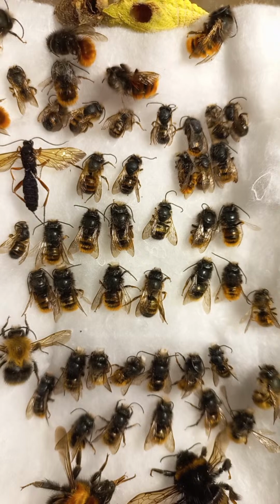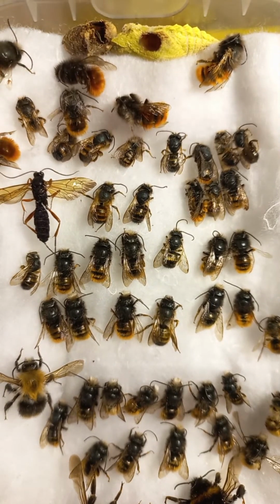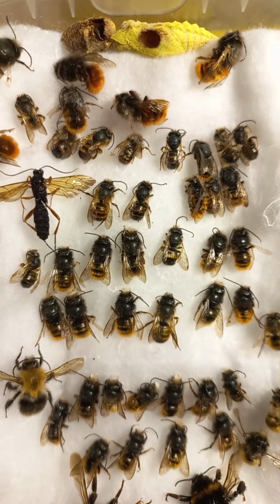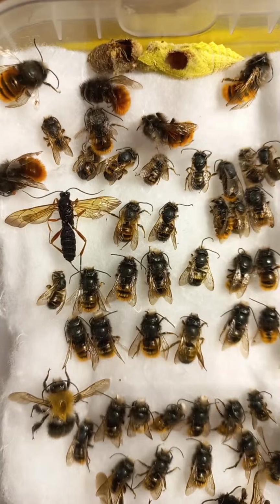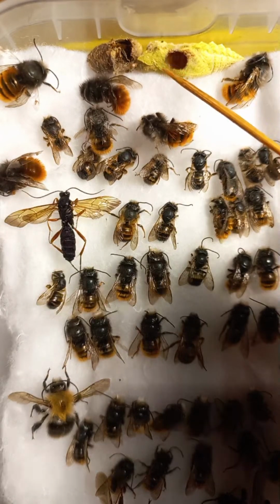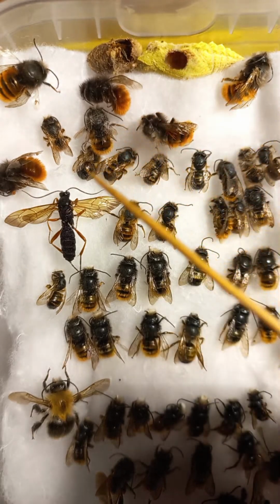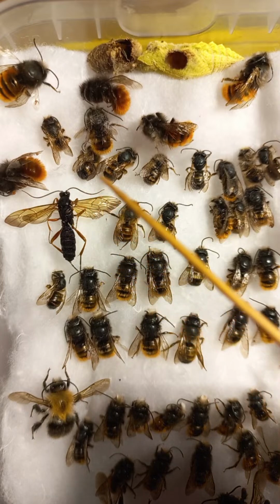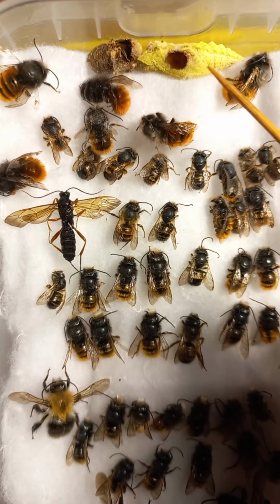So they're still pretty small, because the majority of them here are males. On the upper side you can recognize big individuals with red hairs on the abdomen. This is Osmia rufa. And on the upper side you can see a cocoon of Osmia, a silky cocoon, this one. But this is a chrysalis of a butterfly, and this is an exit hole. This parasitoid of family Ichneumonidae just emerged from this chrysalis or pupa of Papilio machaon.